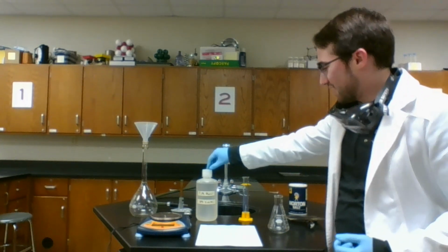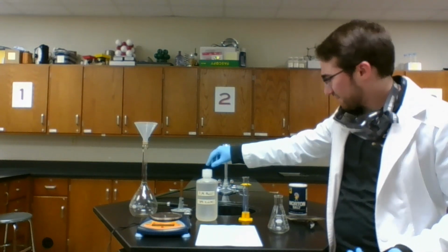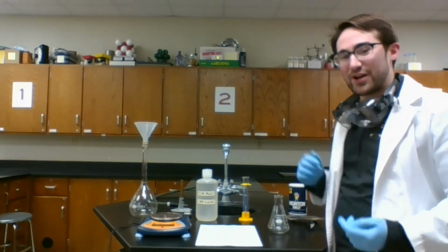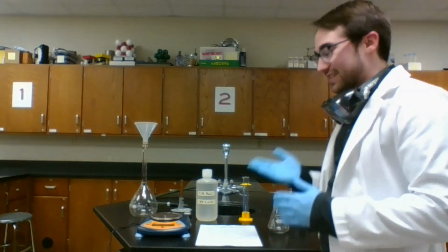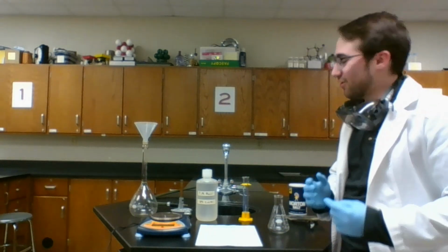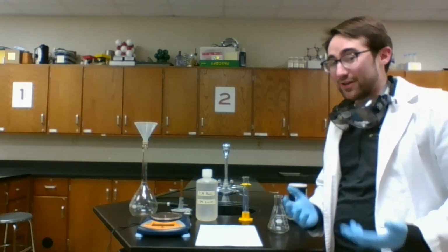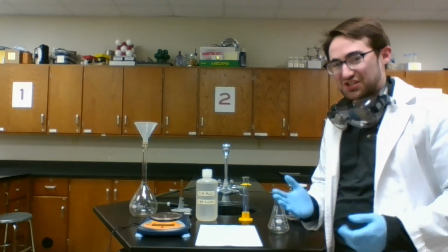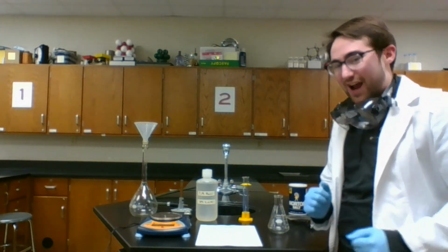With something like salt, sodium chloride, NaCl, however you want to call it, NaCl is not very reactive, so it's hard to find a reaction that's going to tell us how much NaCl was originally in the solution. It also passes through filters because it dissolves very well in water, so we can't just sift it out of there. So we have to get crafty with this.